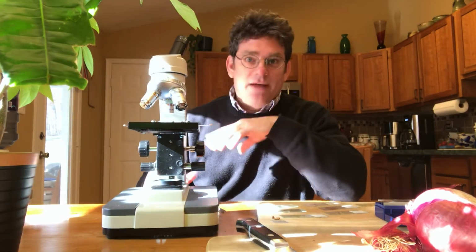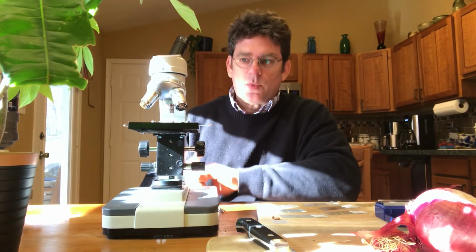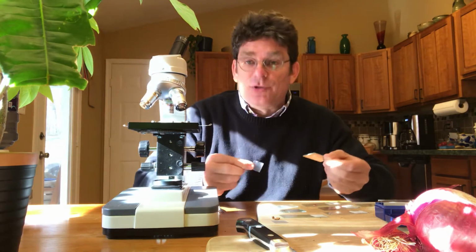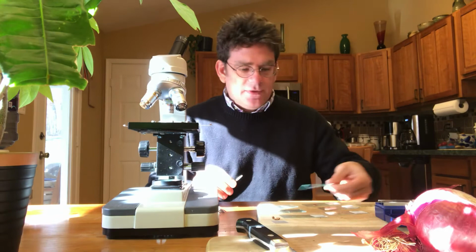Again, I'll try to photograph this just so you can kind of see what I'm seeing, and I'll try my best once we get back to school to show you this as well. But that's a wet mount slide. I'll show you one other thing you can do. Now again, we would not do this in school. We can't do anything with blood or saliva, but because I'm here in my house, I can do this.